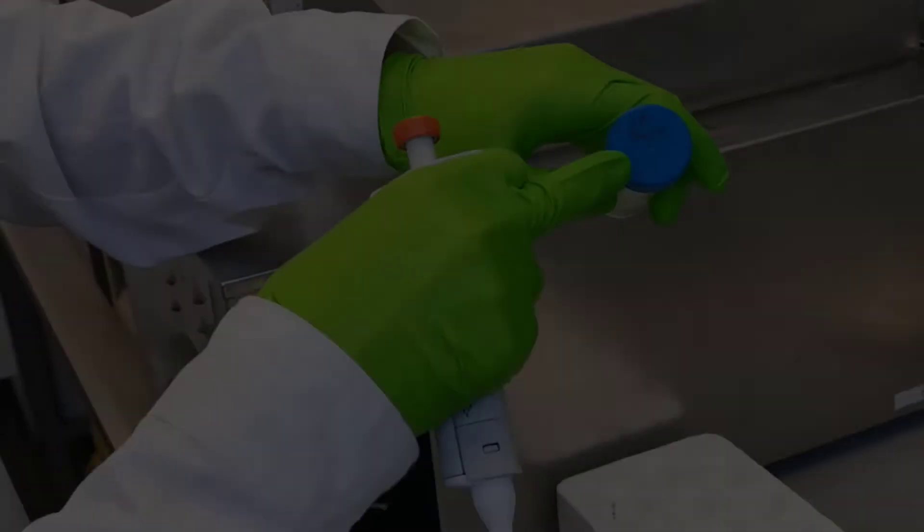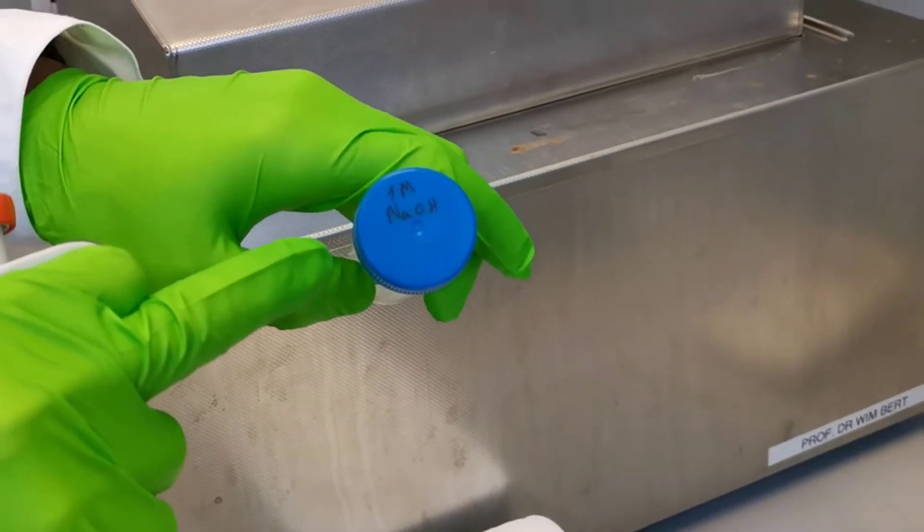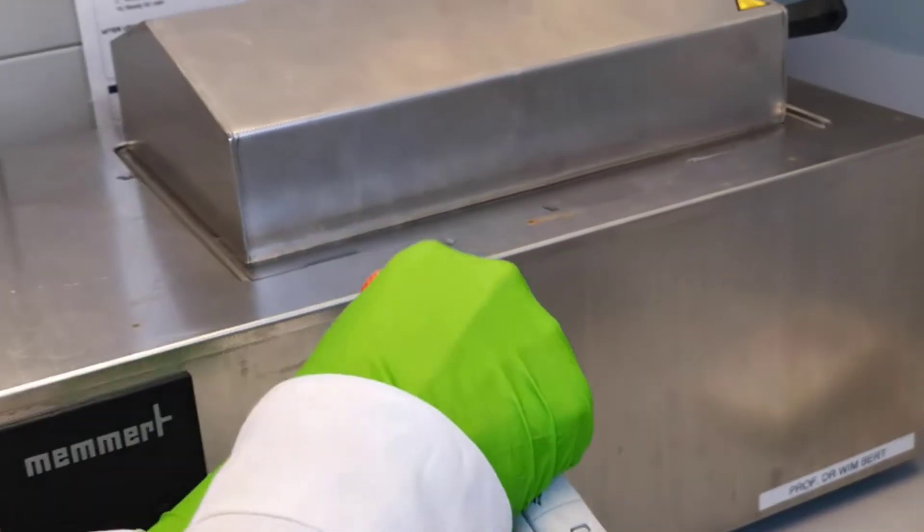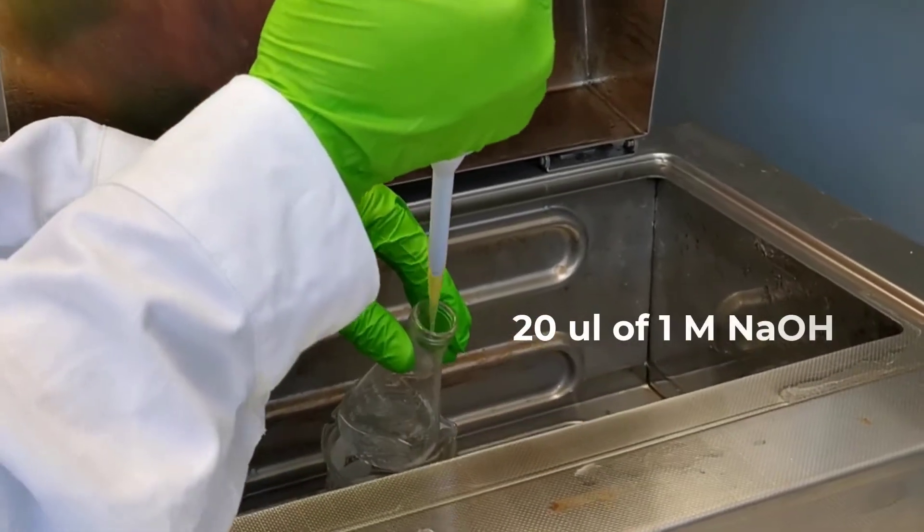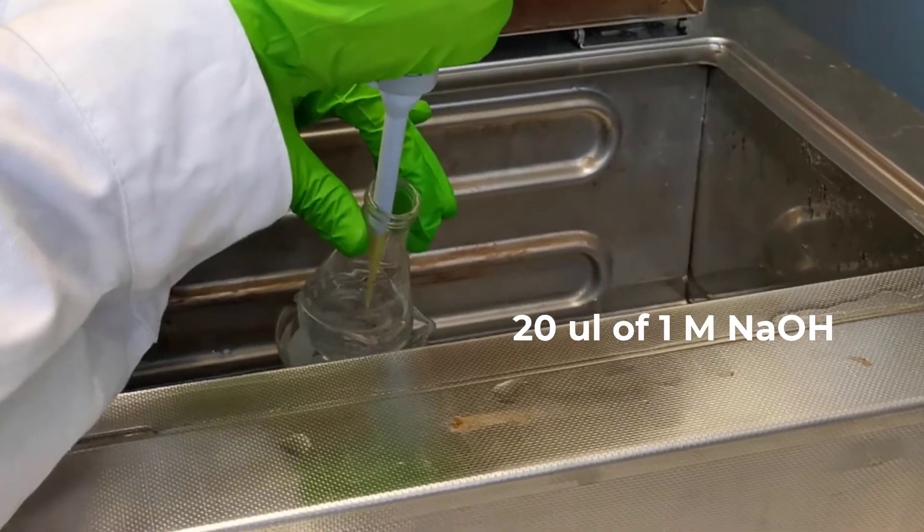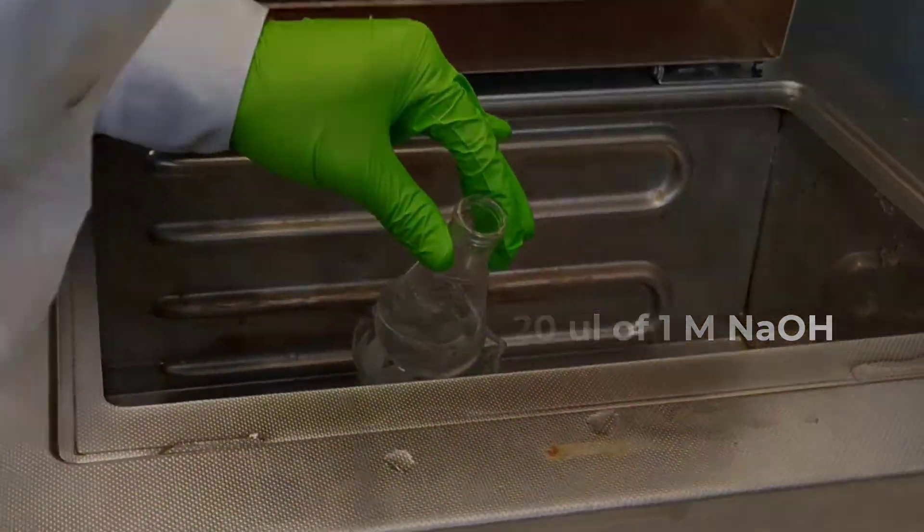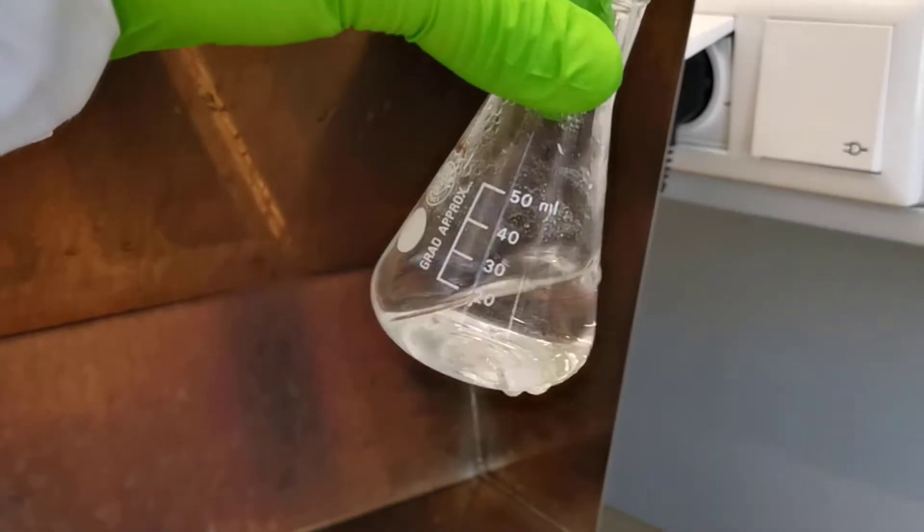After the incubation, most PFA powder will be dissolved, but not all of it yet. Adding some sodium hydroxide helps hydrolyze or dissolve any remaining PFA powder. Here, we are using 20 microliter of 1 molar sodium hydroxide.